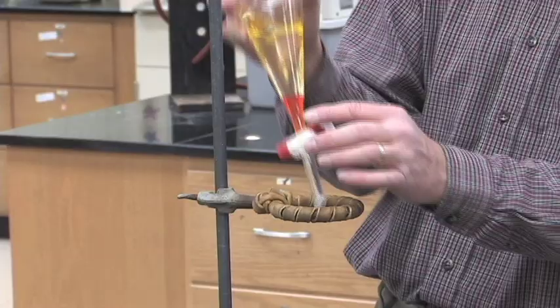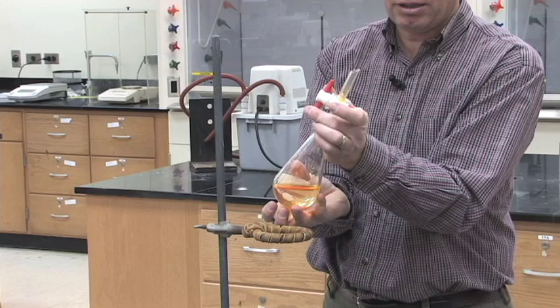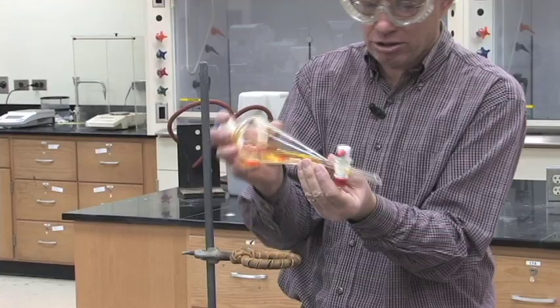When you use the separatory funnel, you'll gently invert it top to bottom to mix the two liquids, and every once in a while when it's pointed up, open the stopcock to vent it and release the pressure inside.